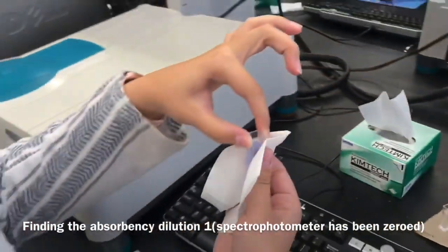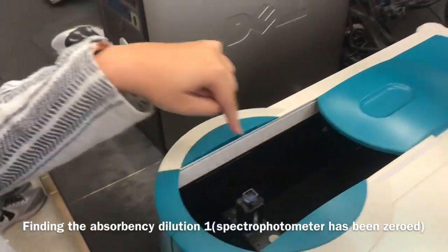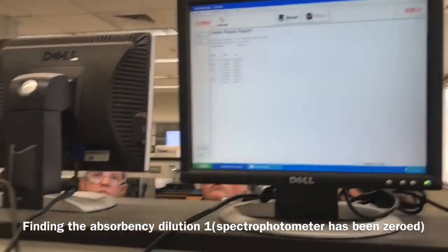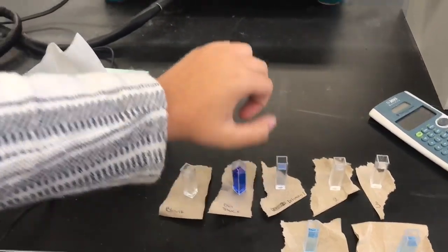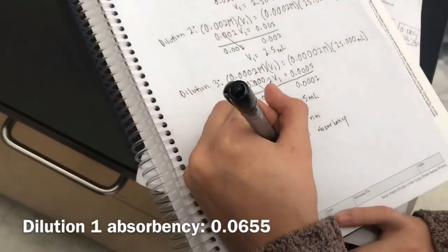Here, Rachel is using the Simple Reads program on the spectrophotometer to find the absorbency of dilution 1. She is making sure to close the spectrophotometer before scanning, and she carefully removes the sample from the spectrophotometer and shuts the door when finished. The absorbency of dilution 1 was 0.0655.